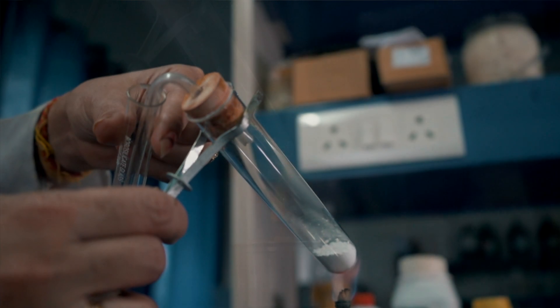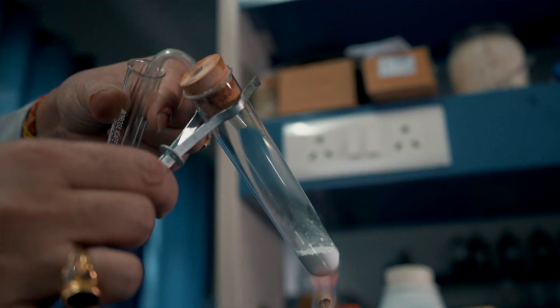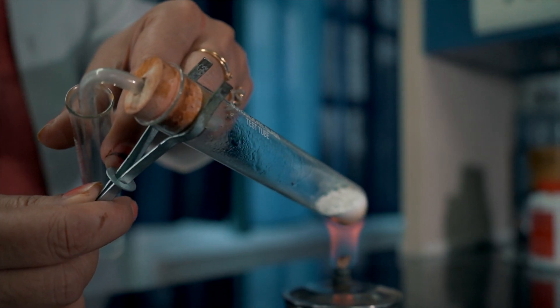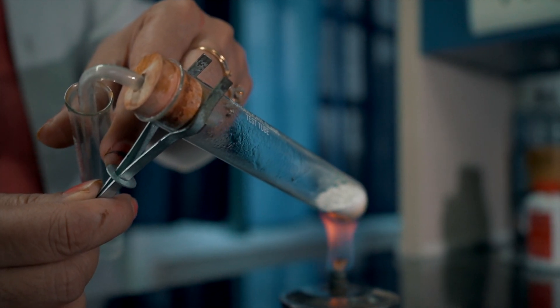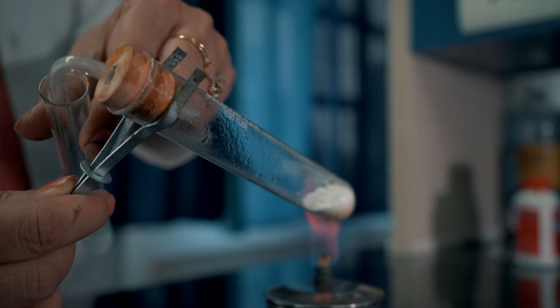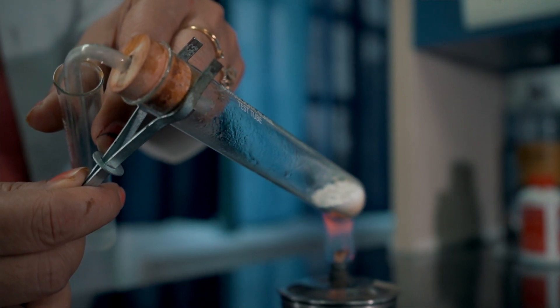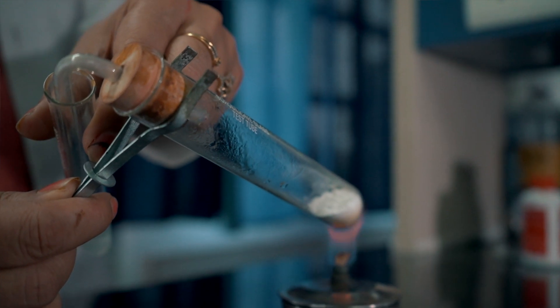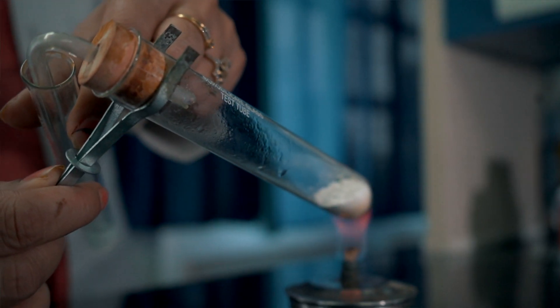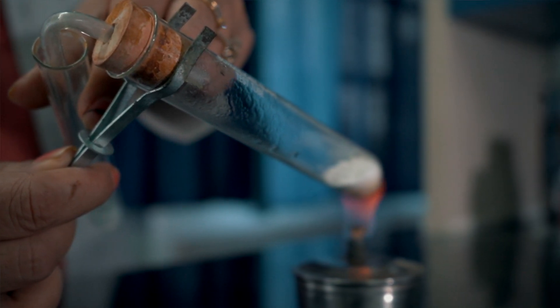Can you see the bubbles in the test tube? These are carbon dioxide gas molecules. Lime water turns milky due to the formation of insoluble calcium carbonate produced during the reaction.